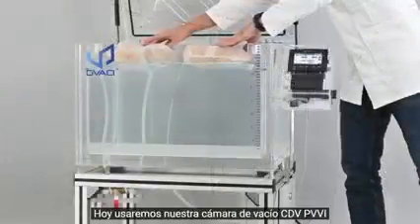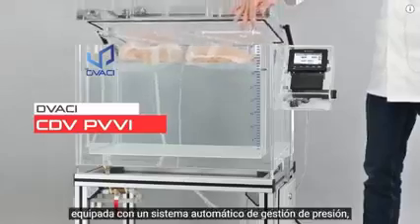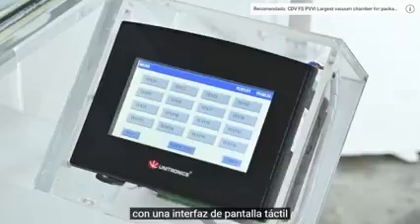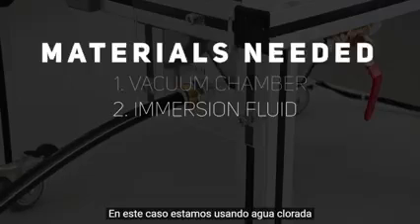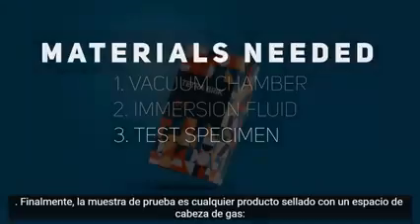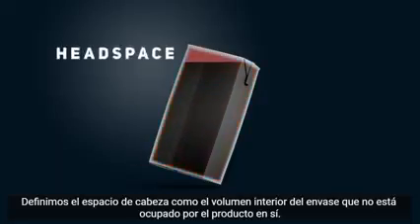Today, we will be using our vacuum chamber CDV PVVI, equipped with an automatic pressure regulating system, with a touchscreen interface and built with a convenient draining system for the immersion fluid. In this case, we are using chlorinated water. Finally, the test sample or specimen is any sealed product with gas headspace. We define headspace as the inside volume of the packaging that is not occupied by the product itself.